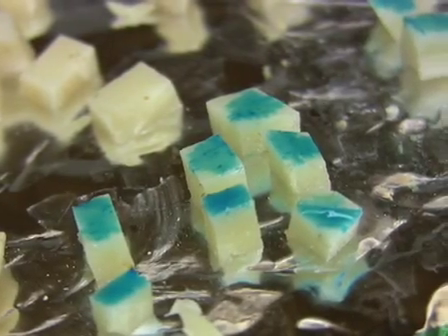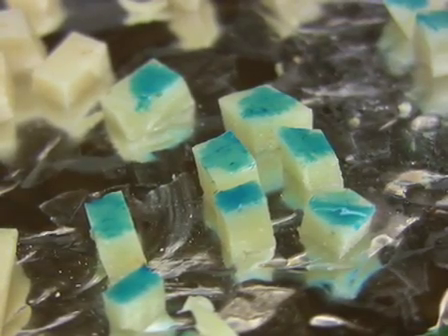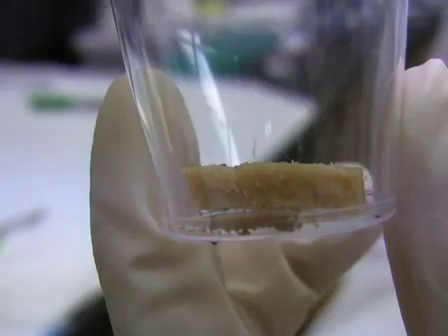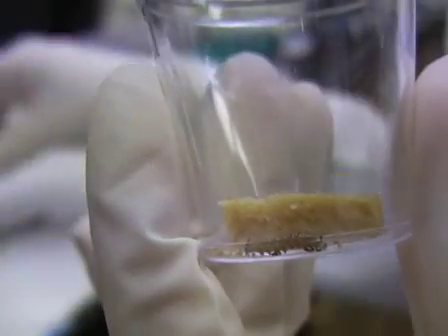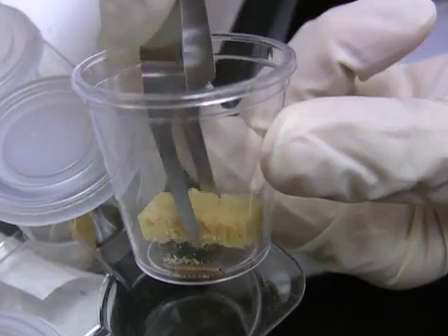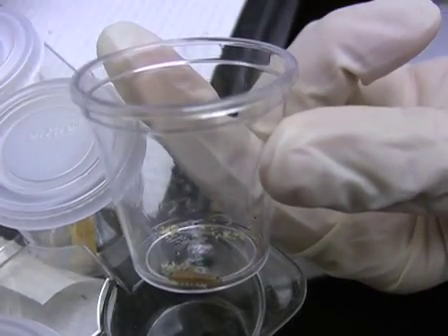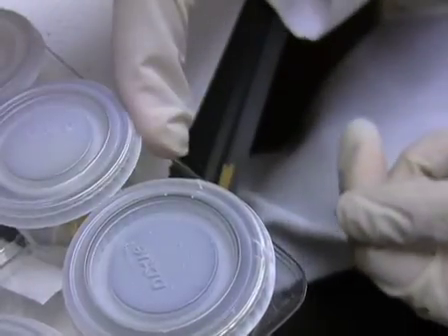Now I'll show you the diet plug bioassay. In the diet plug bioassay, mid to late instar larvae are fed on a diet plug treated with a known dose of virus to determine the lethal dose, or LD50. On the day prior to conducting this assay, remove the diet from the cup to starve larvae overnight. This step will increase the speed with which the larvae consume the virus-inoculated diet cube.